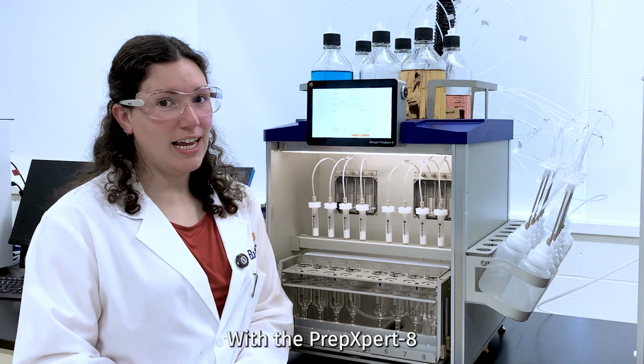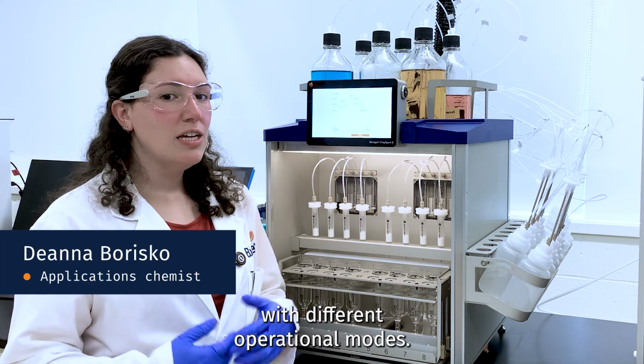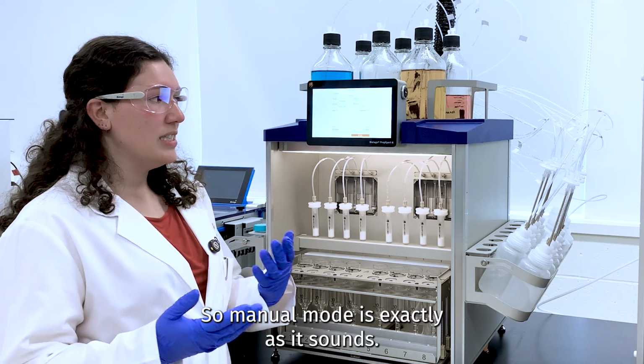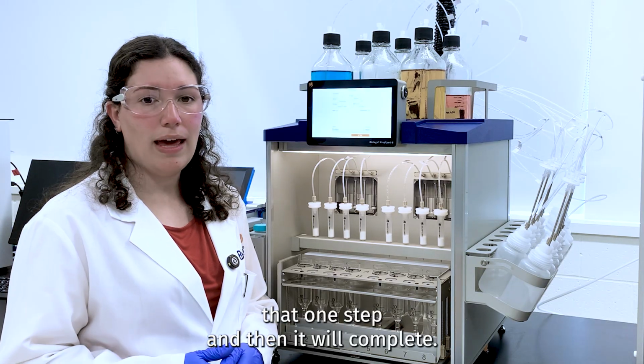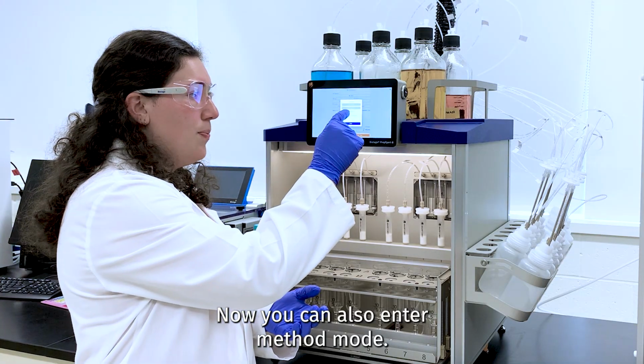With the PrepXpert-8, you can choose how you want to run the system with different operational modes. So the first mode I'm going to go through today is manual mode. So manual mode is exactly as it sounds. You have one specific step, you input those parameters, and the system will run that one step, and then it will complete.